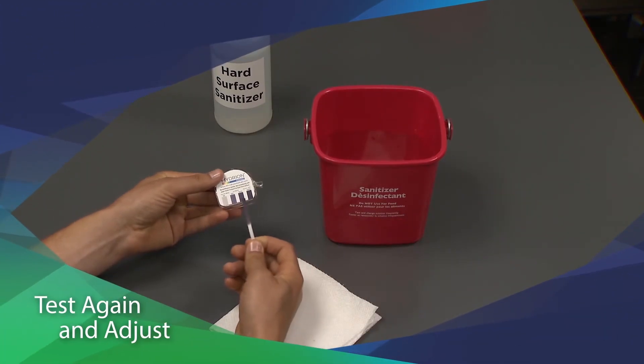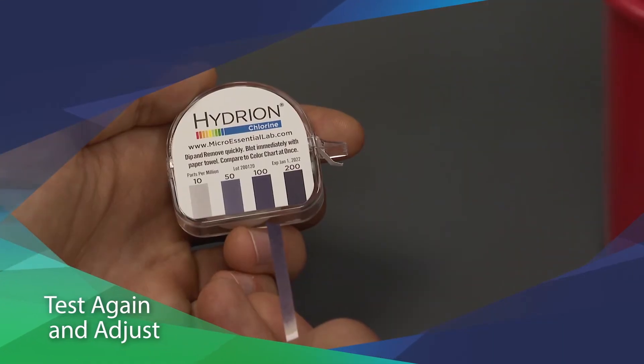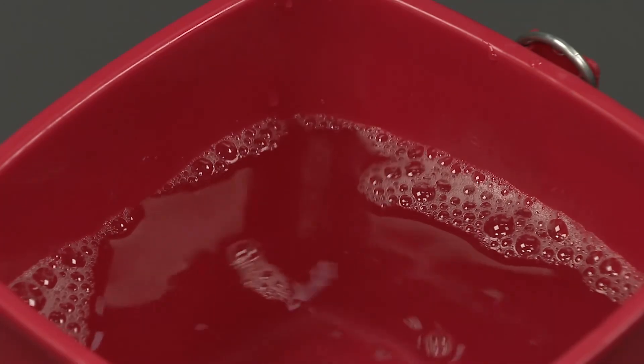If the concentration isn't at your target, test it again and adjust the solution as necessary. Or just make a new batch.